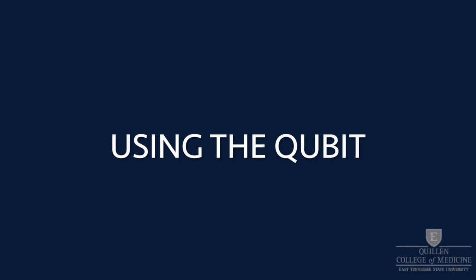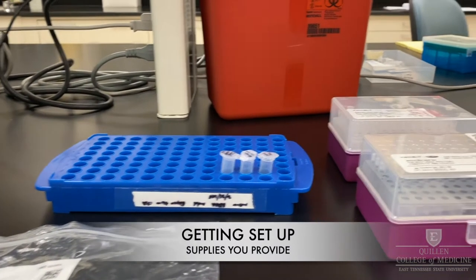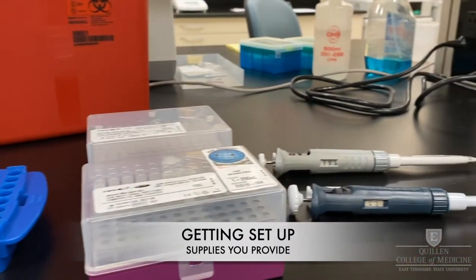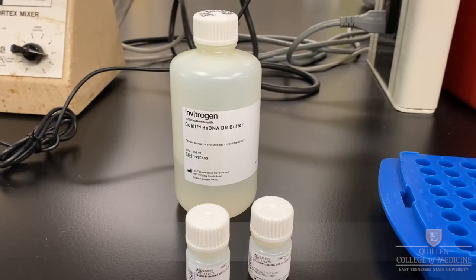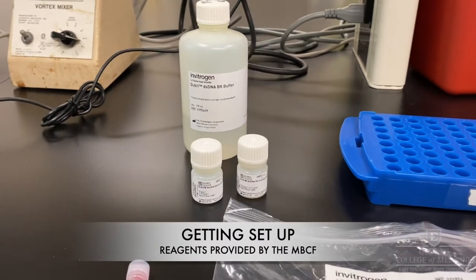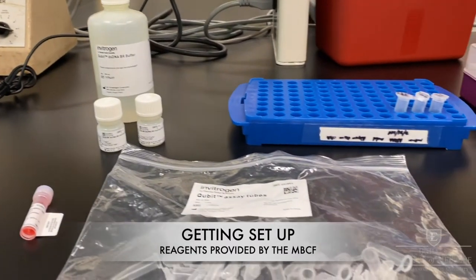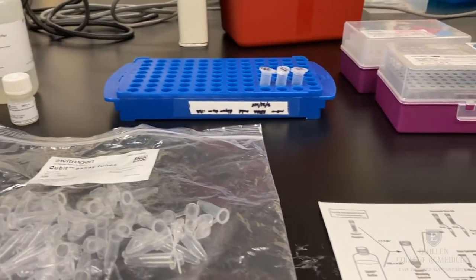Using the Qubit Fluorimeter, bring to the CORE facility your sample, pipette tips, and pipettors. We will provide a dilution buffer, standards, fluorometric reagent, Qubit-specific assay tubes, and a quick start guide.